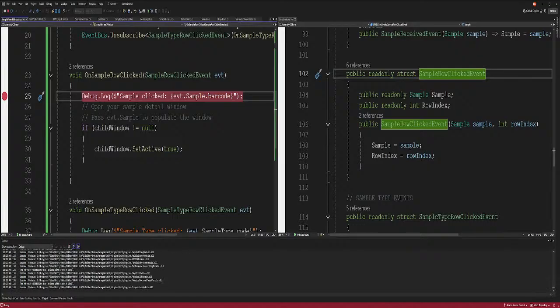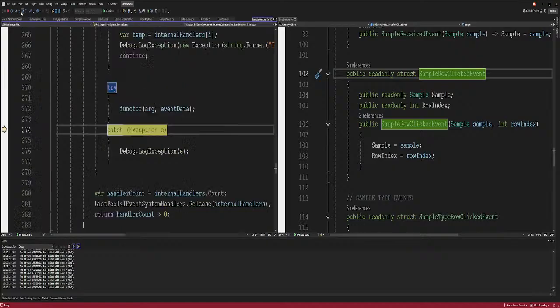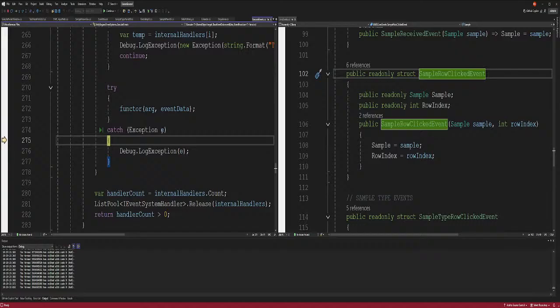So basically, you have an event that's going to be called, and whoever's listening is going to open up and do whatever you want. It's just passing you info, and you do whatever you want with it. I want to know why. All right. So here we go. We have barcode. Awesome. An exception. Object is not an instance of sample. Okay, what object? Let's do this again.